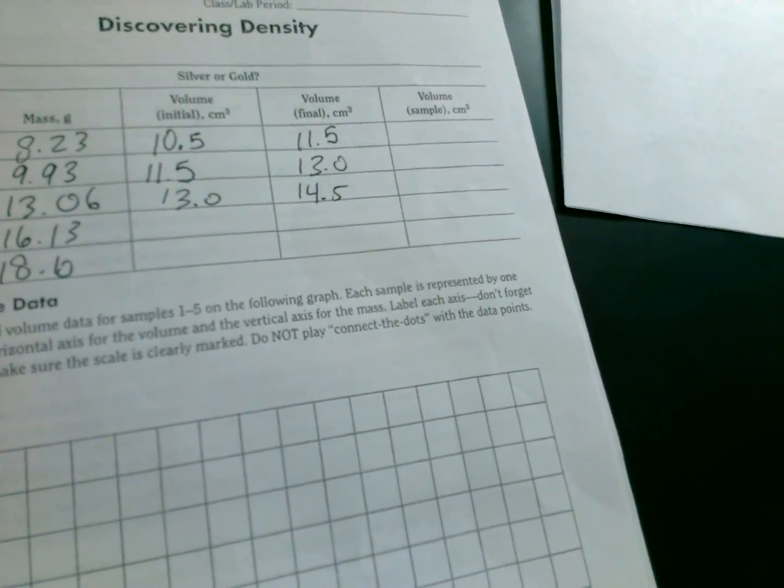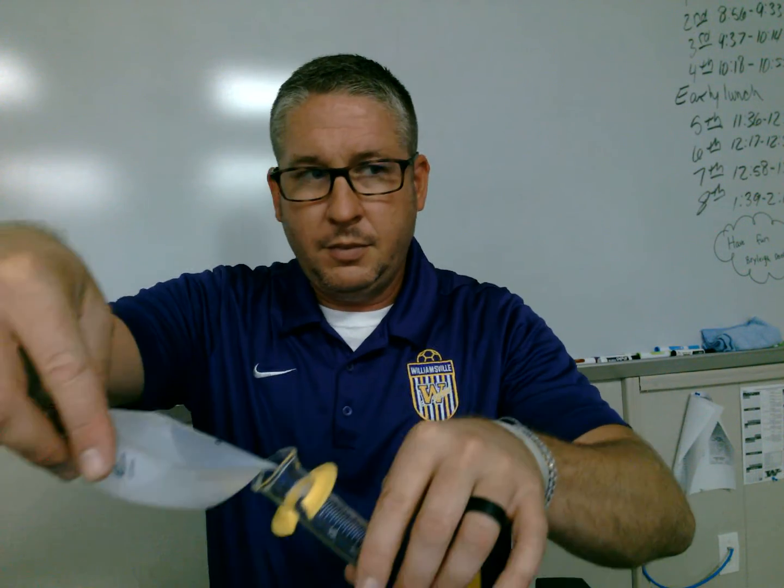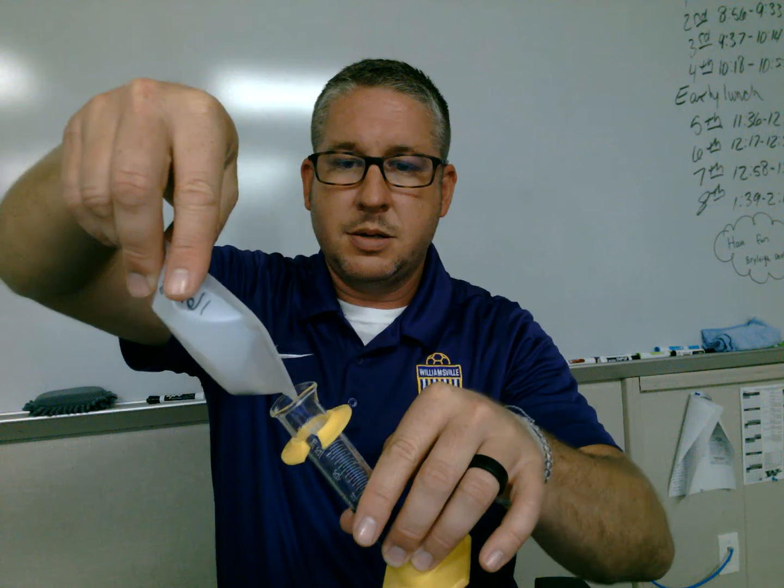Okay, so again, I'll put that there in my file. Transferring that down in here to my initial. I've got 2 more masses I need to do. Making sure I pick up the correct labeled one. Again, tilting.